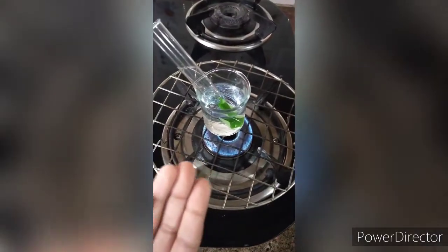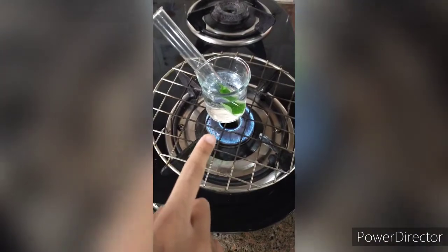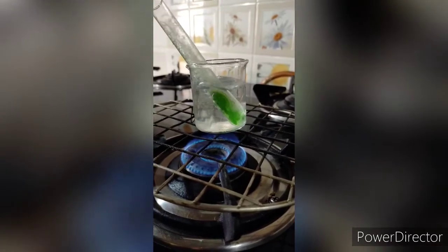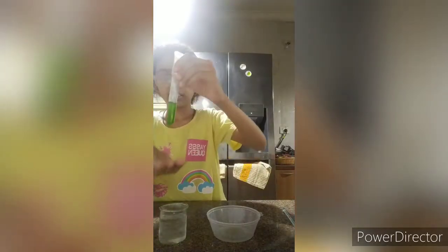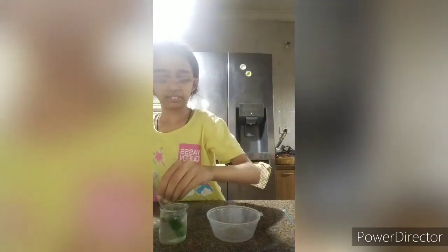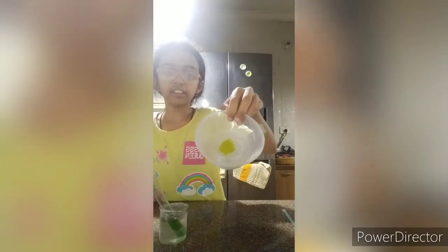Now, I am going to boil this beaker over a flame. I have placed the beaker half filled with water and the test tube within it over a flame. Let's observe the changes. We are observing that the colour of the leaf is coming into the spirit and is mixing with it. This is the green colour chlorophyll in the test tube which has come out from the green leaf. This is the leaf that has lost its green colour which is chlorophyll.